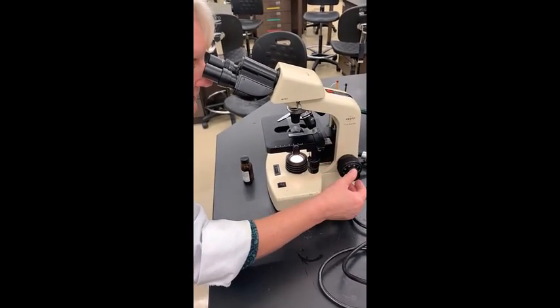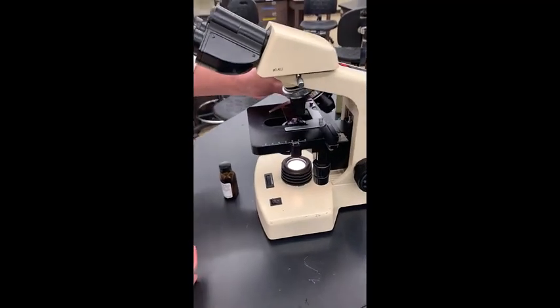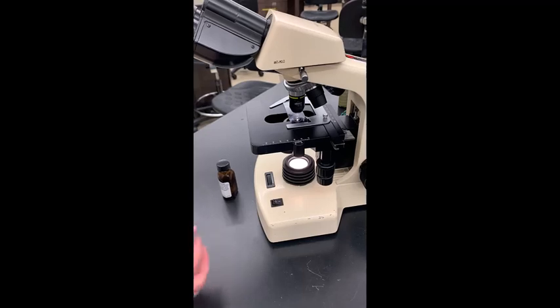Then use the fine focus and choose an area of the smear in which the cells are well spread out into a single layer.